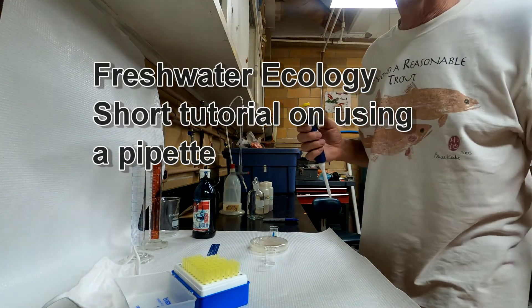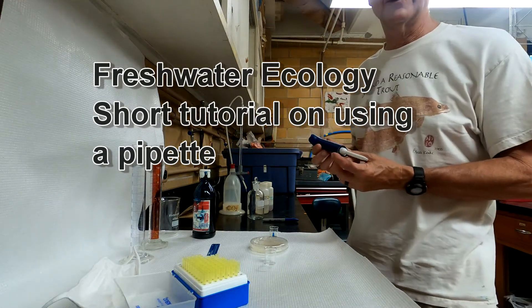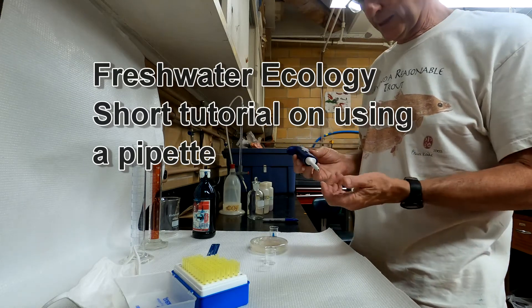Hi, today I'm demonstrating how to use pipettes. We're going to be using these for our nutrient assays.